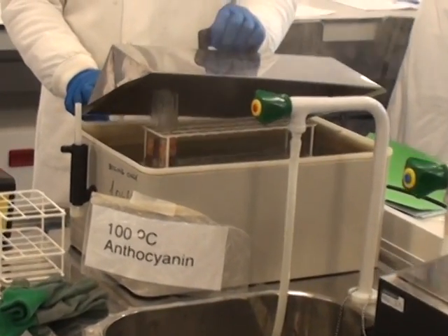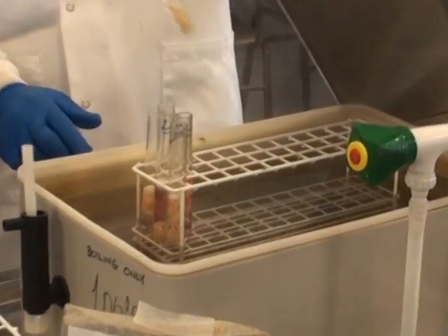These test tubes are then put into a boiling water bath for two minutes to extract the pigment.